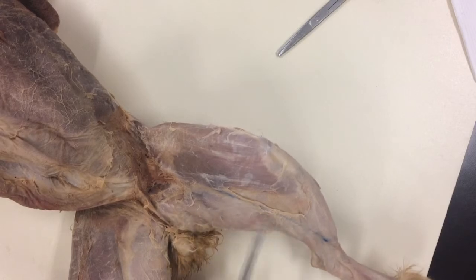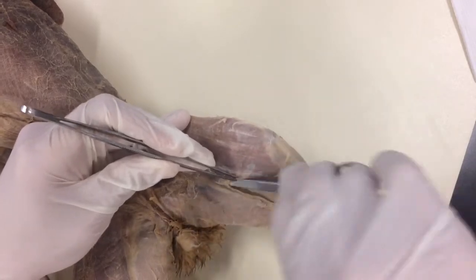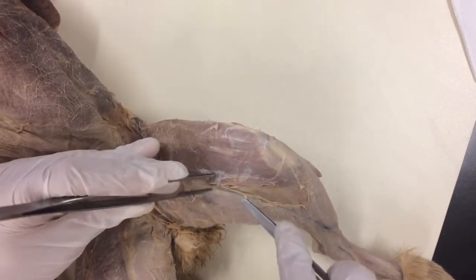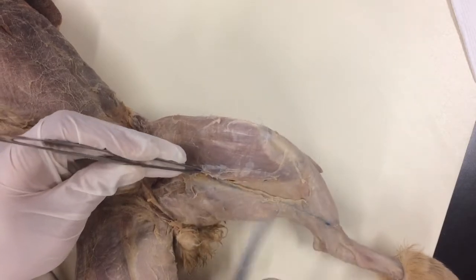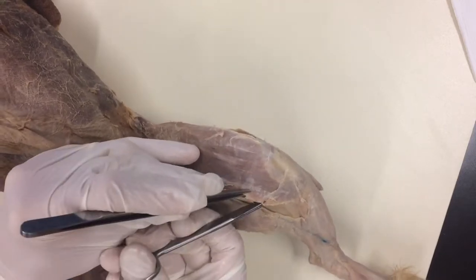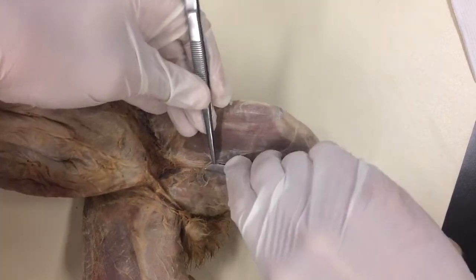We want to come down right here, so don't get into this vein yet. You've seen this technique before — I'm just going to make a hole right on the edge of it. Now I'm under it, and you can see I'm just wiggling here. The vein goes under, so let's be really careful. We want to go over the top of that vein. Now that it's open, I can get enough pressure — you can see I went right over it. I'm taking my scissors and I'll open that up a little bit. You can see that muscle; we're going to bring it right out to the edge of the knee. And we're going to cut through that tendon — I'm going to cut right through this tendon and leave that attached to the other muscle. You can see my scissors come out — that's where the line is.